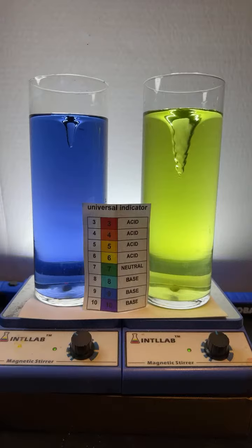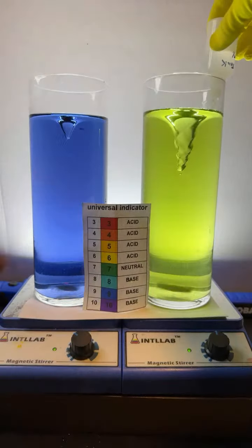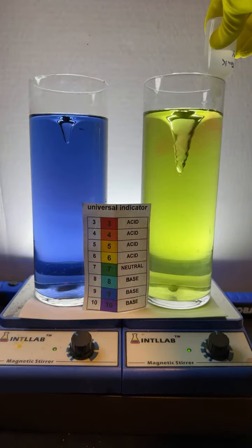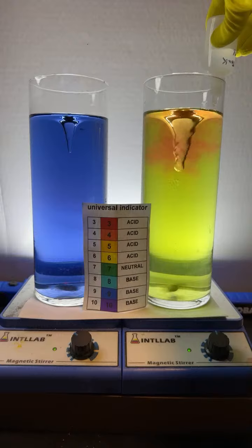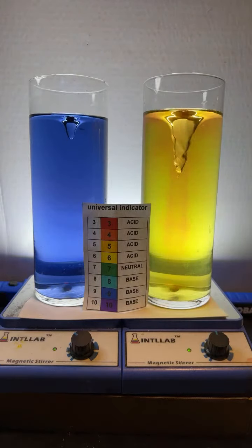You're saying the fastest should be somewhere in the middle. If I had it on the outside, would it disperse quicker? Asks Giange. I'm sorry I'm not saying your name right. Let's find out over here, okay? Over here on the right, I'm going to add drops of acid on the edge. So that's 4 drops. And it does indeed look like it's dispersing quicker.